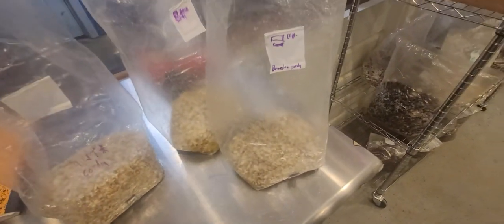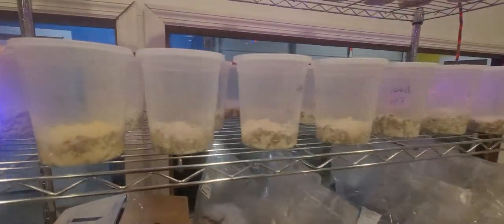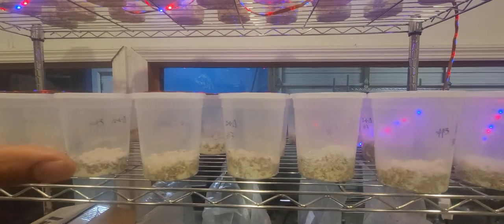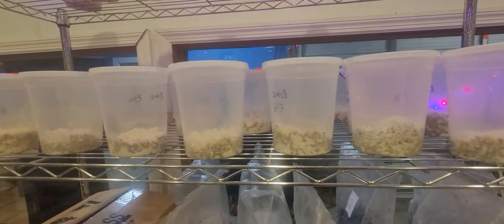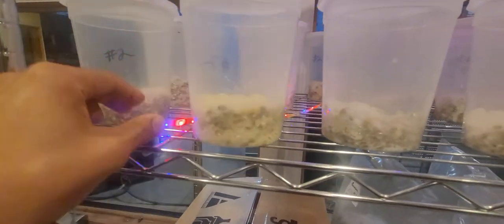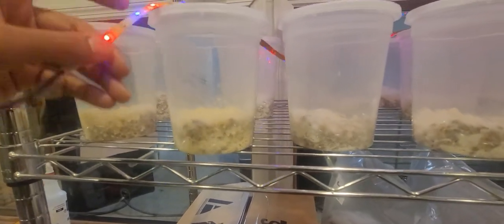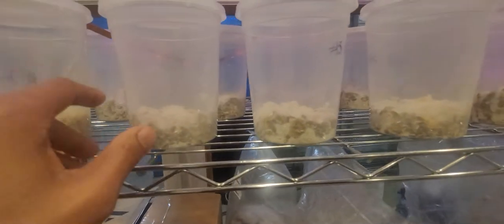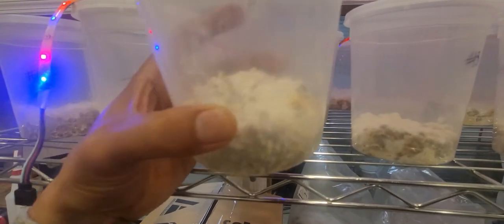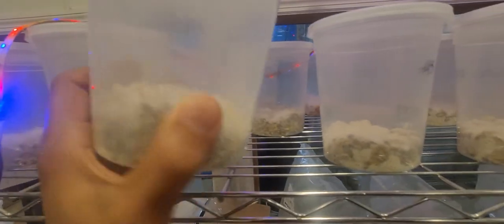Now this isn't the normal technique — there are all different types of ways to do it, so I'm just playing around. I've got three different recipes here and different tissue samples from the specimens I cloned outside. Ultimately they're progressing; we just need to see if I actually have a fruiting tissue sample. I don't know if it's going to fruit or not, so we've got some little orange things in there.